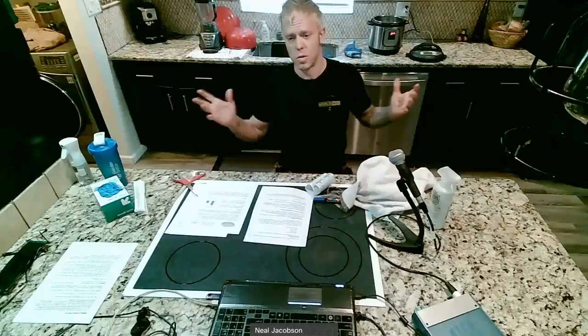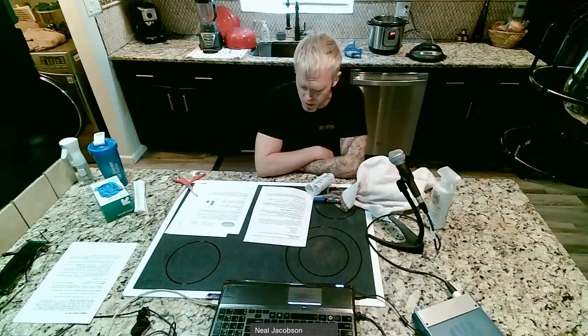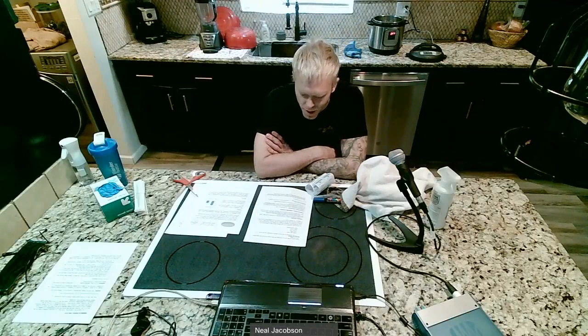Back for part two. So this is where we get to actually use our petri dishes and to sample stuff. So we start with the hand washing experiment. Just ignore the one experiment per table. So this was adopted from the lab manual.